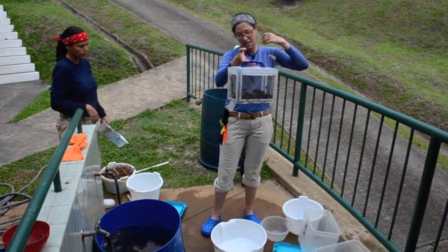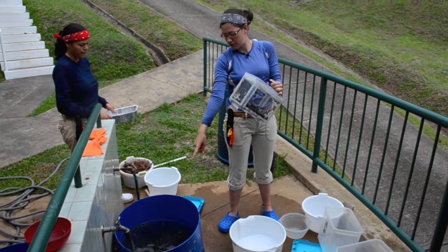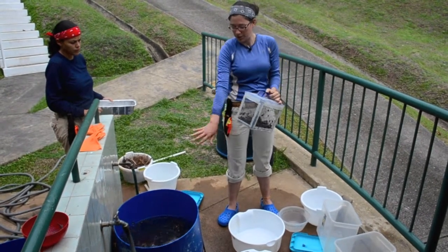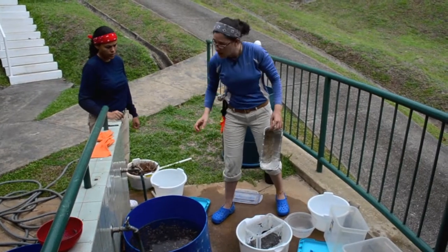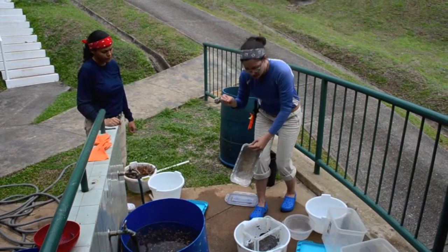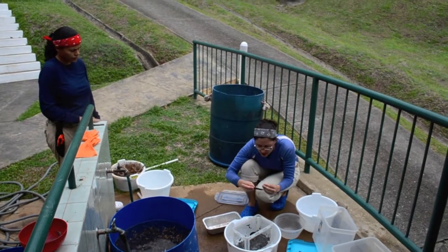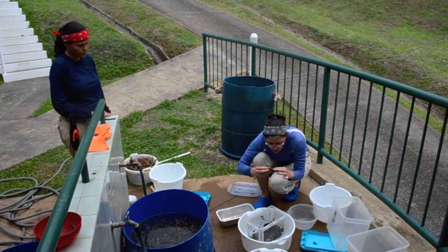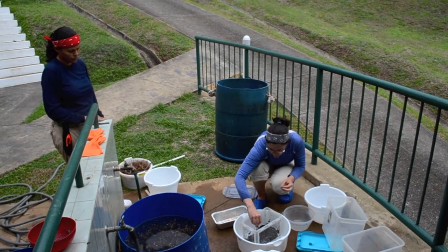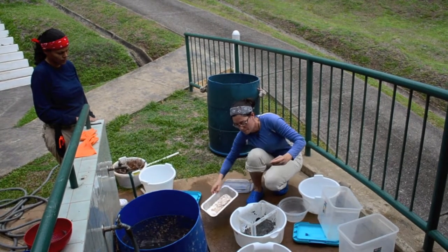Okay, so here you can see there's a lot less in here than there was because there's some small parts that came out here. We're going to use all of these parts and collect all the parts of the sample, but those are just for the next step. So this is 1 centimeter, and the parts of the sample that are more than 1 centimeter in diameter aren't part of the sample because they're considered larger woody material. I'm only using parts that are less than 1 centimeter in diameter. So everything that's part of the sample goes in here.